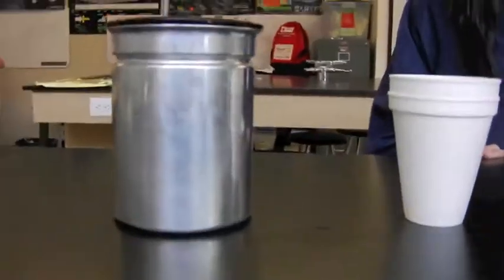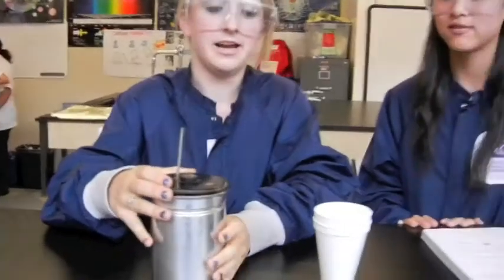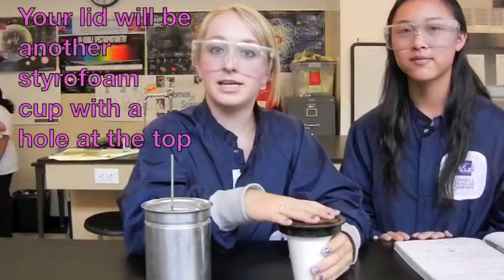Wow, I wonder what these things are. It looks like a cup. I wish Crystal were here to explain it to me. Well, Kathy, these are calorimeters. As you can see, this is a real calorimeter, one you probably aren't working with today. You'll be working with our generic styrofoam cups, and for now, we will use this as our lid to keep the heat in.